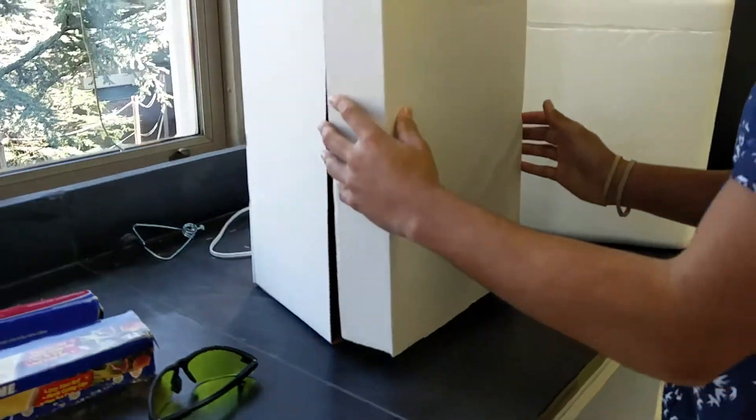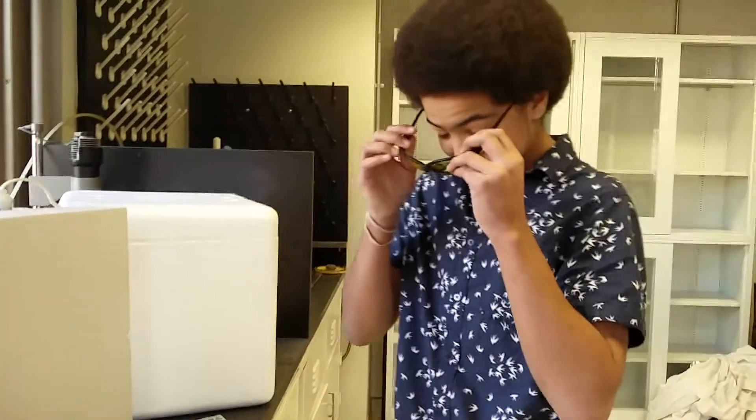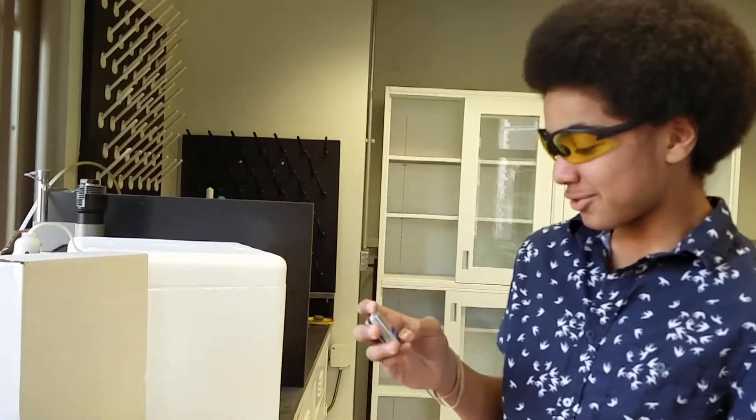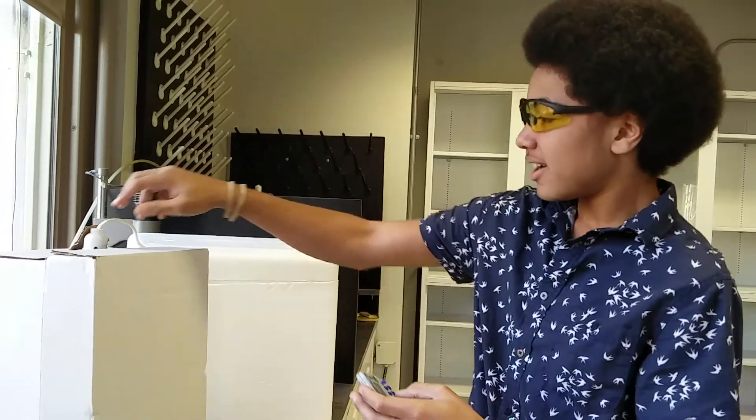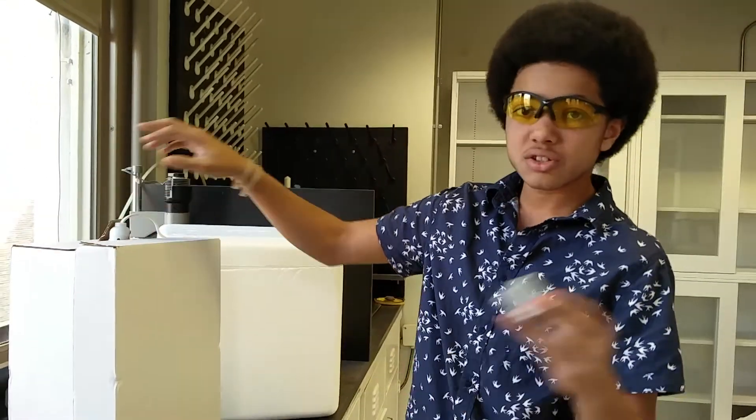Put the lid back on, and it's not really necessary but the glasses look cool so you can put them on anyway. Now you can see I have my timer set for 45 seconds. As I turn the light on, I'm going to start my timer.